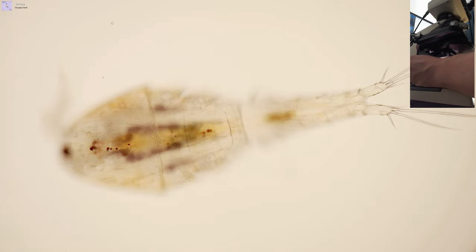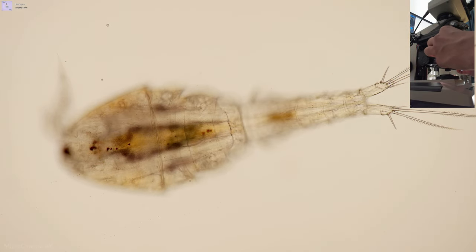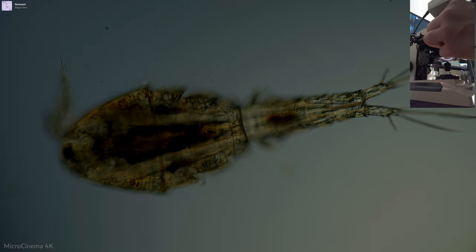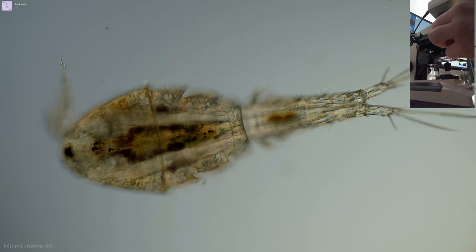So there we go, we got a nice Köhler again, and then to switch into DIC, it's really straightforward because I've already got a polarizer in. So I just need to change over to the 10X prism, open my iris all the way, and then pop in the DIC slider. And then we'll just bump the exposure up again.